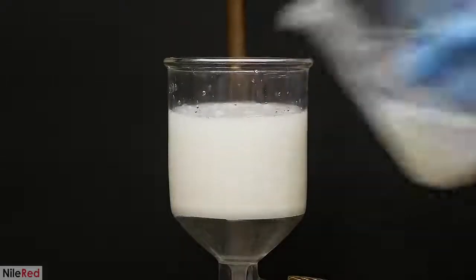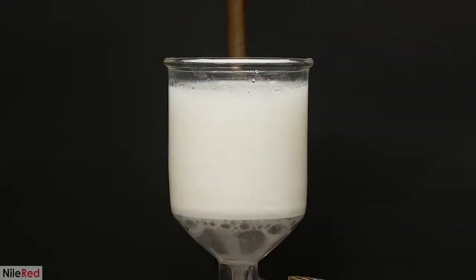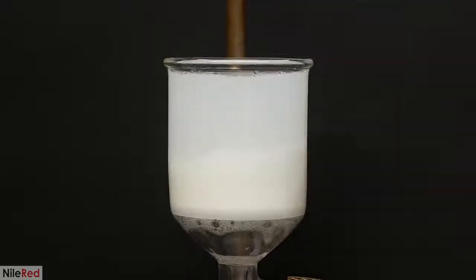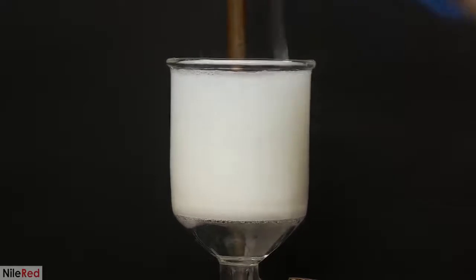To separate out the triacetate, I just dump it into my vacuum filter and I turn on the pump. All of the water is quickly pulled out, but unfortunately, this is the beginning of the kind of annoying part. The reaction mixture that I'm filtering off is highly acidic, and well, this gets all absorbed into the cellulose. So just pulling away the water isn't good enough, and there's a whole bunch of acid that's still trapped inside.